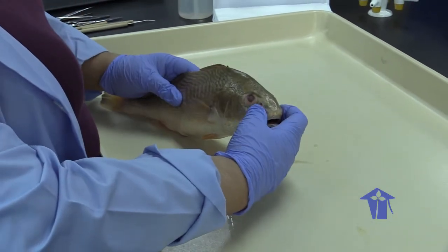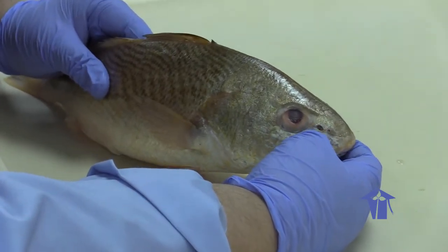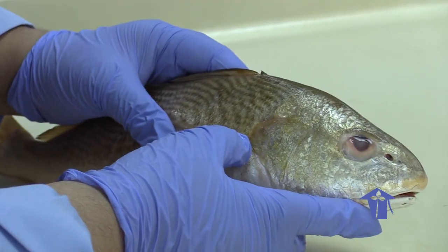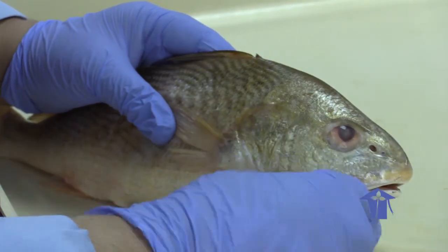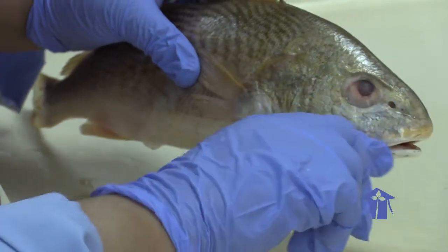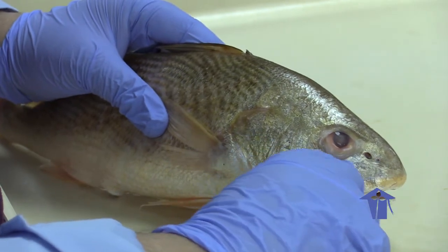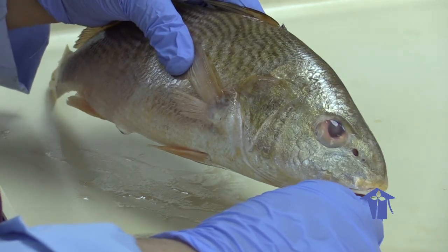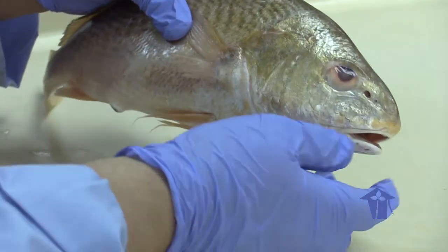You also have the nares. You see there are these two openings here that are used to sample the water body as the fish swims through it. From the position of the mouth, you can also tell where in the water column this fish feeds. So fish that feed up at the surface of the water, their mouths are normally up at the top of their head because they're going at the surface of the water like that. Fishes that feed in the middle of the water column, their mouths are in the middle of their head like this. And fish that feed on the bottom, their mouths are to the bottom of their skulls. Right? So this fish is more accustomed to feeding towards the bottom of the water column.